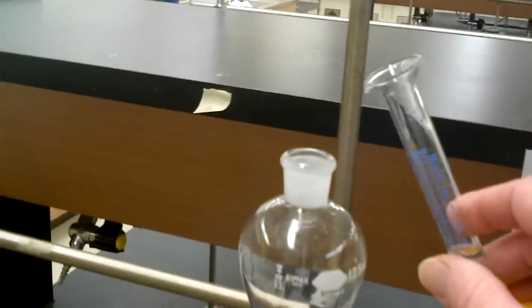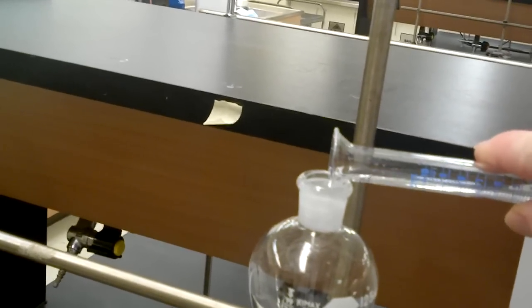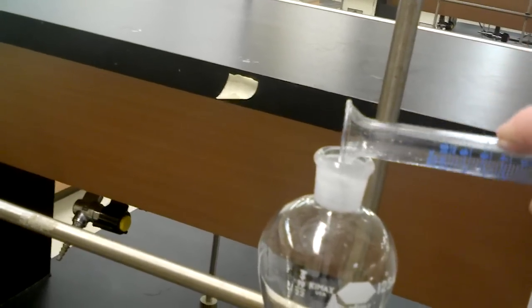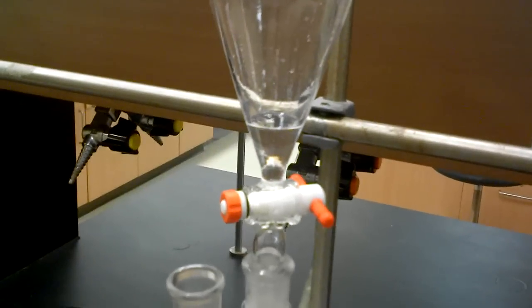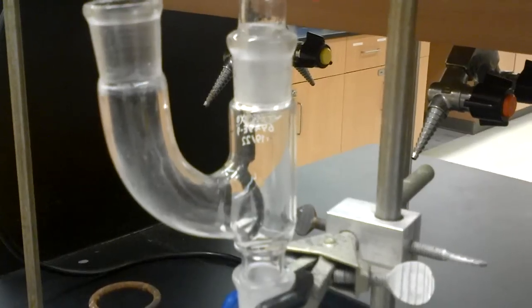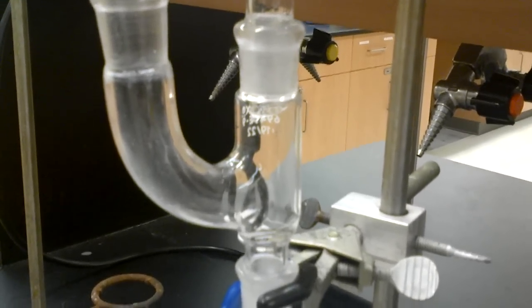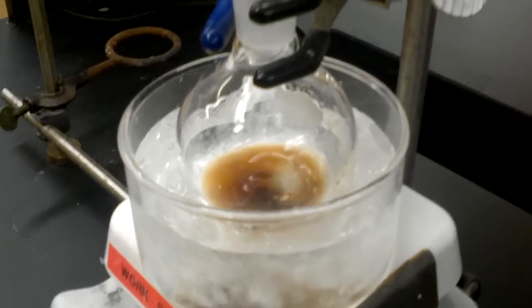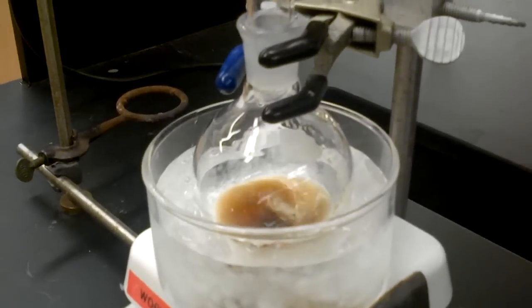So now we can go to our nitric acid. The nitric acid-sulfuric acid mixture can be carefully added to the top. I don't want to spill this time, because then I'll just have to clean up again. And you can see we will add this very slowly over the next 10 to 20 minutes. So our slow addition is continuing, and we start to get some interesting color changes. We must go slow, and we must keep it cool, please.